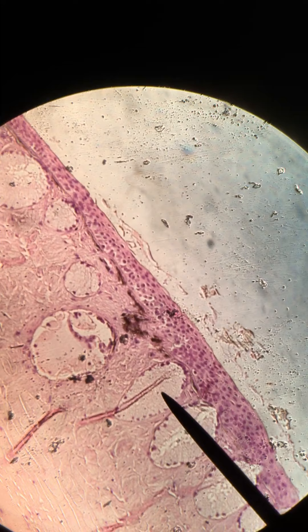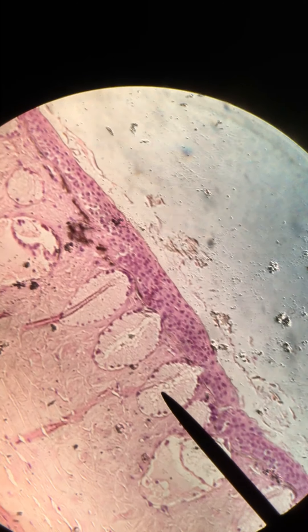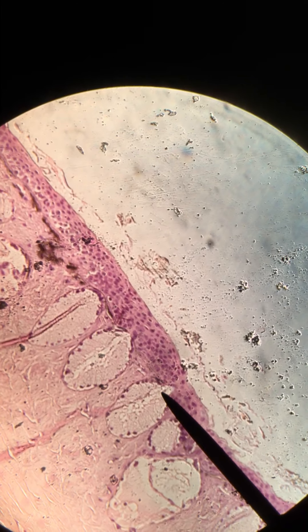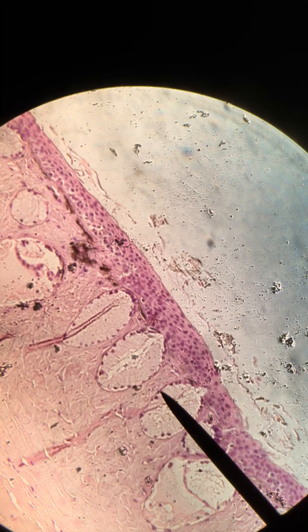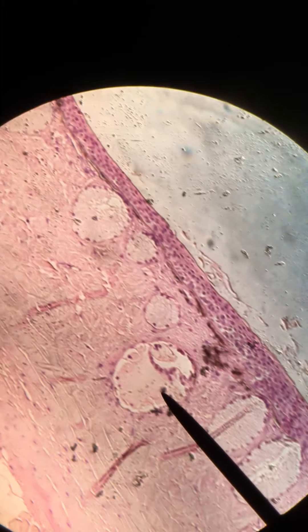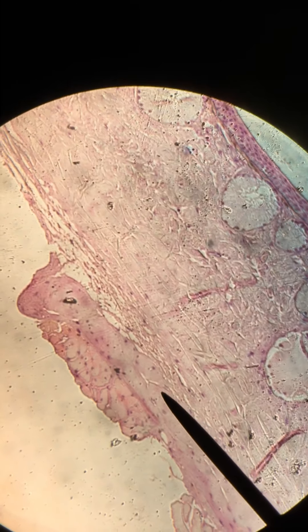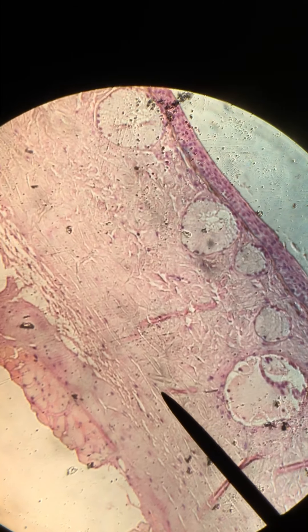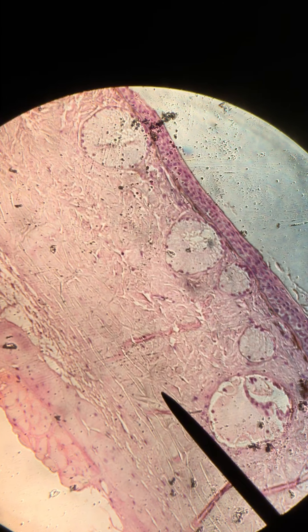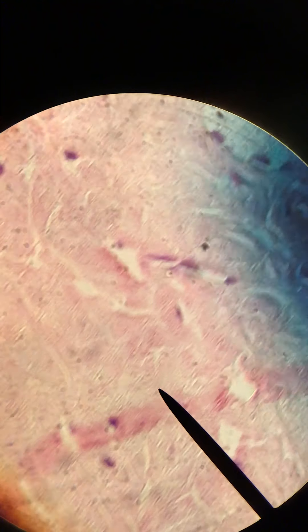And then these circles — these are blood vessels which are lined by simple squamous epithelial cells, all these little purple dots. And then I think I saw some skeletal muscle over here — yes, you can see down here there's some skeletal muscle. We are going to zoom in now to get a better picture, and I'm going to increase to now about 400 times.